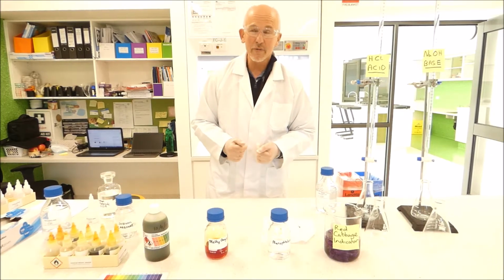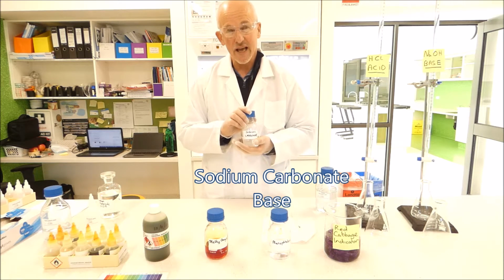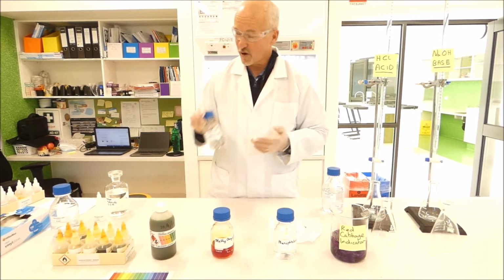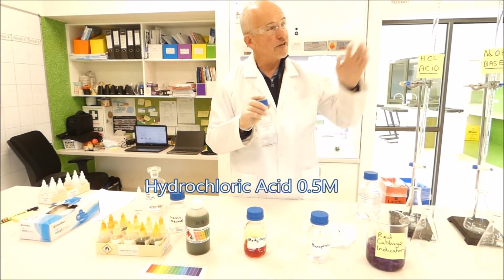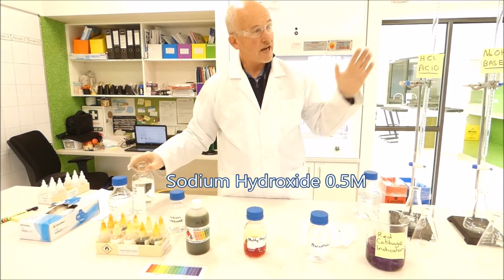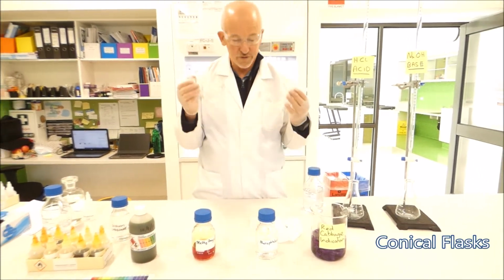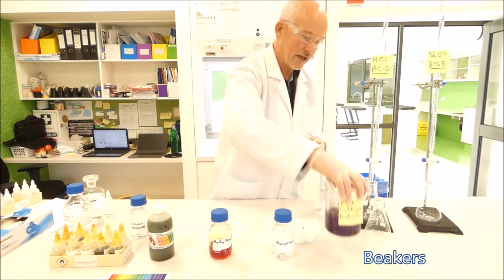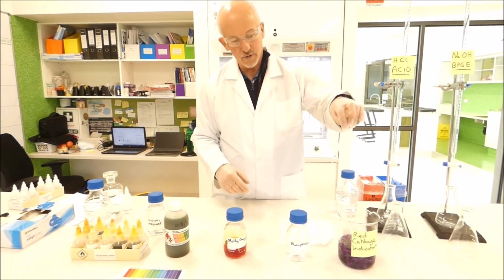Some other chemicals we're going to be using in this experiment. We're going to need sodium carbonate, which is a basic solution, which is going to be used for something called a Rainbow Fizz experiment, which is quite an interesting experiment. Of course, we're going to need our hydrochloric acid solution to refill our burettes, and our sodium hydroxide solution to fill our other burette. We're going to need various other glassware. So we're going to need our conical flasks. We may need some beakers to make the red cabbage indicator. We're going to need some small pipettes to apply our indicator solution.